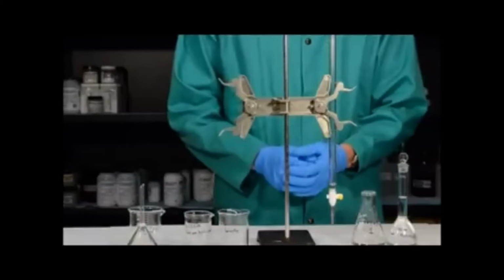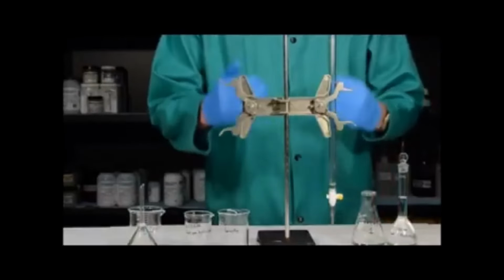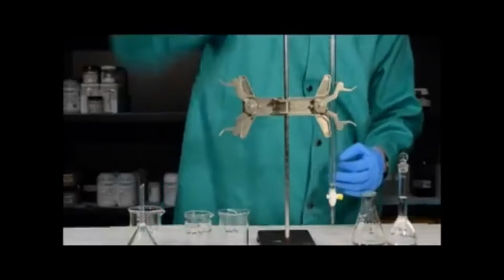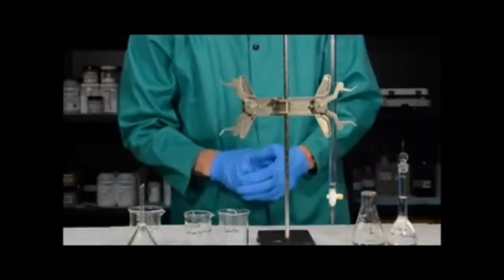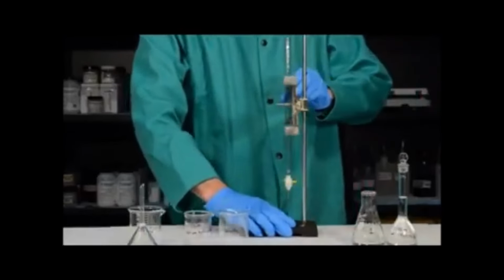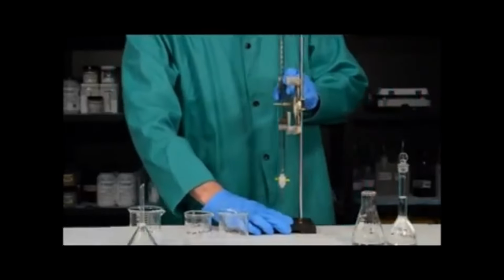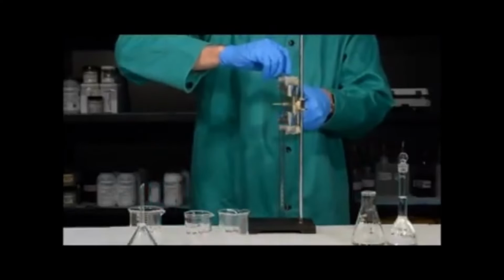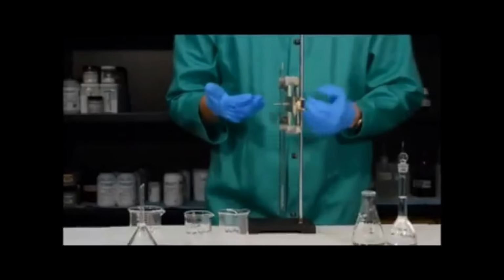To rinse a burette with water here, what we're first going to do is lower the burette down. For many people, you would be reaching up over your head in order to pour the solution into the burette. In this case, we're just going to rinse it with water. To lower the burette down, we simply put the burette at the edge of the table and then lower the burette so that it's an appropriate level to work with.